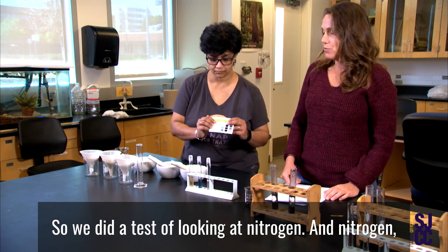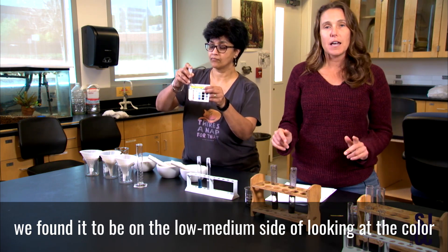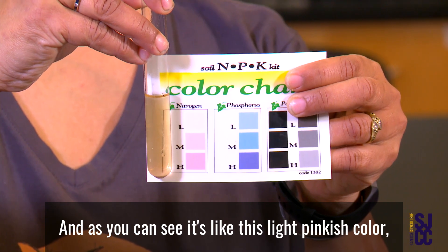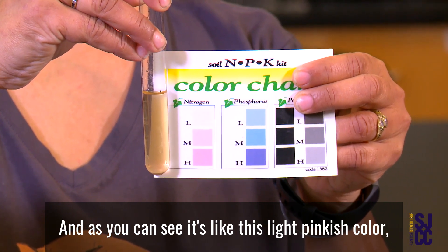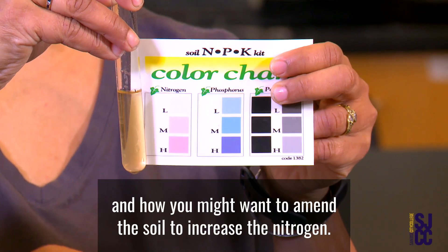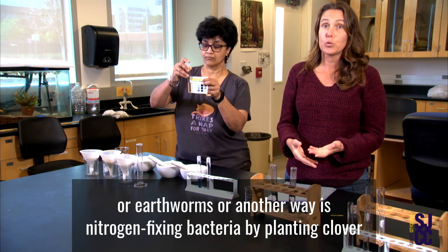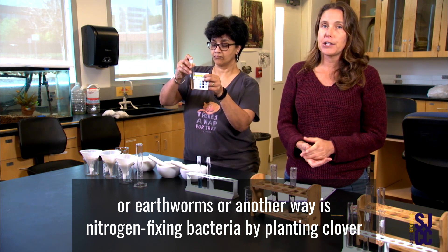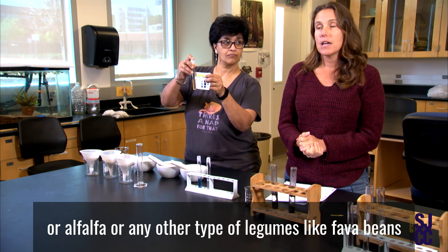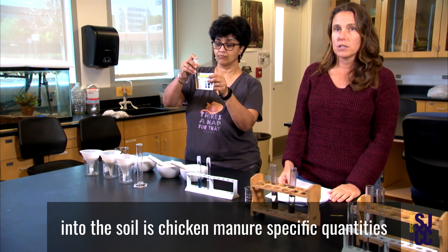We did a test looking at nitrogen, and we found it to be on the low to medium side, looking at the color indicator from the soil extraction. As you can see, it's a light pinkish color. That's not necessarily good or bad — it just depends on what type of plant you're trying to grow and how you might want to amend the soil to increase nitrogen. You can add compost, earthworms, or nitrogen-fixing bacteria by planting clover, alfalfa, or other legumes like fava beans and working them back into the soil. Chicken manure at specific quantities is also a good way to increase nitrogen, though you don't want to add excess nitrogen as it could burn the plants.